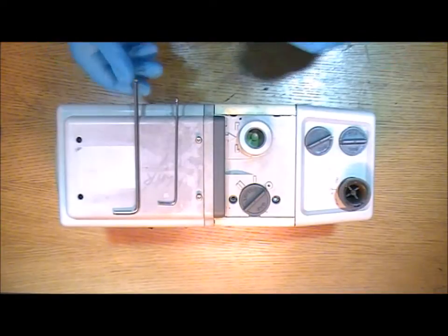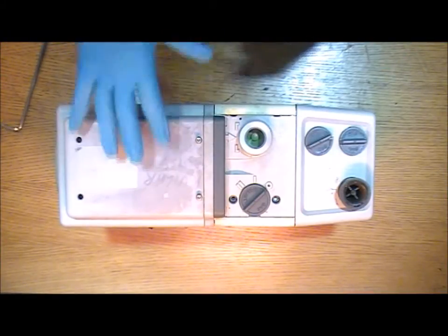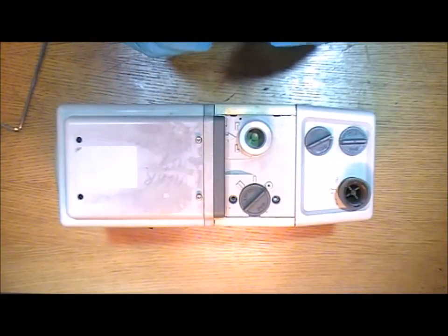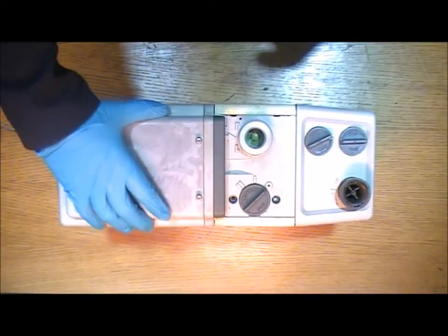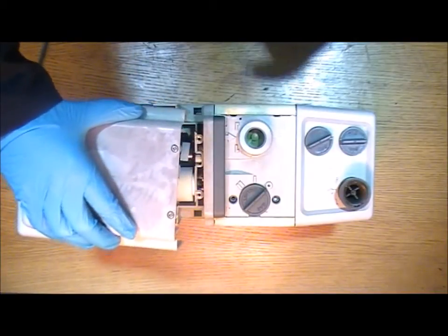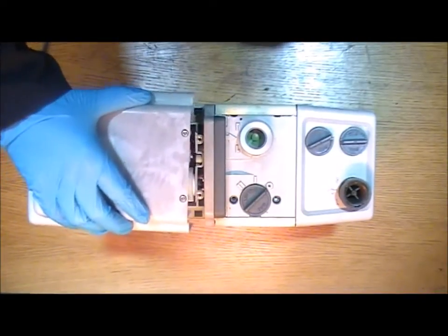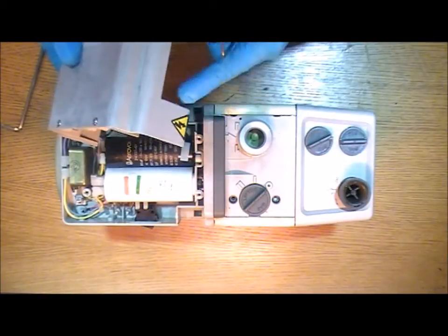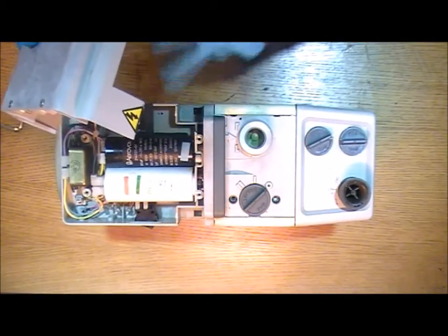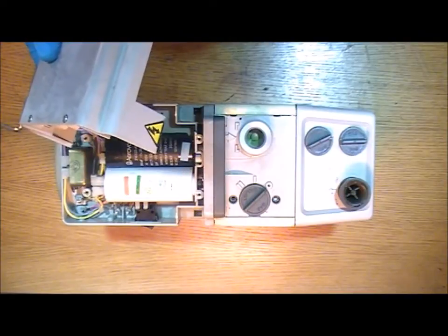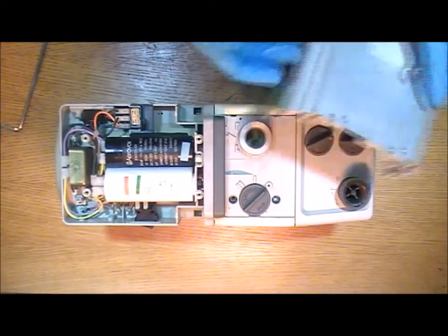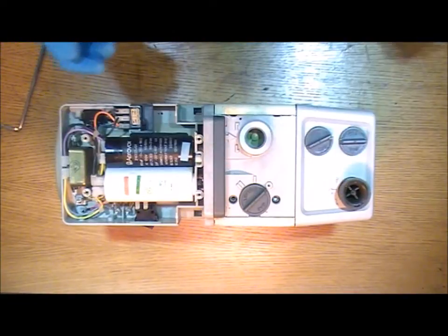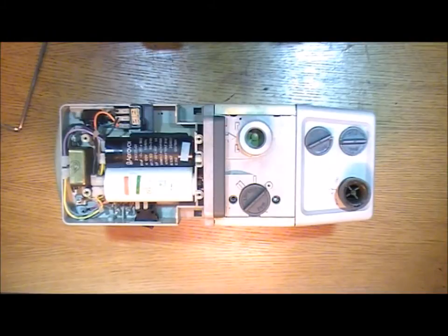So to get started you've got to remove four screws from the cover plate of the motor here. I loosened these already so they're ready to come out and the cover plate just lifts off. However, normally after these pumps have been running for a long time the plastic parts around here tend to weld themselves together with the heat. So it can be a little bit difficult. Provided you've taken out the four screws you can then use a flat blade just to work around the edges until it comes loose and remove that.